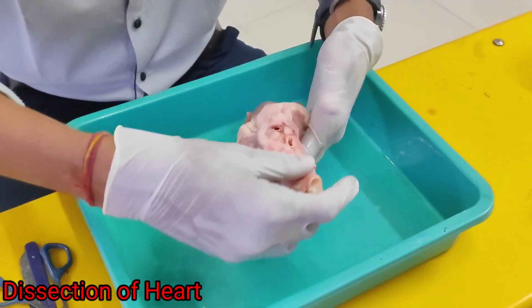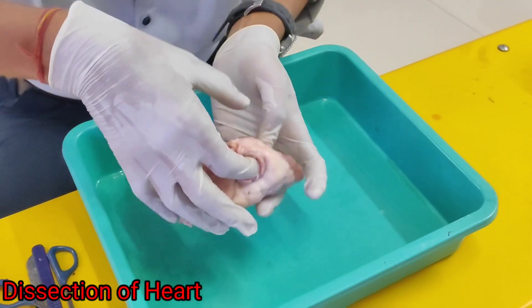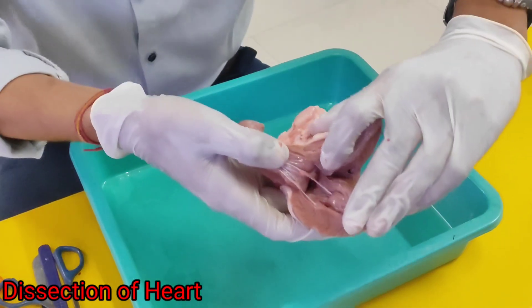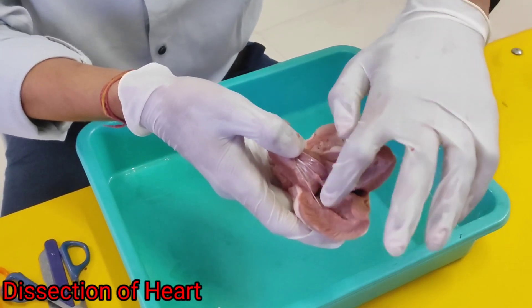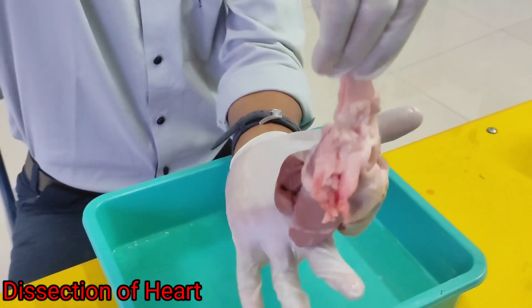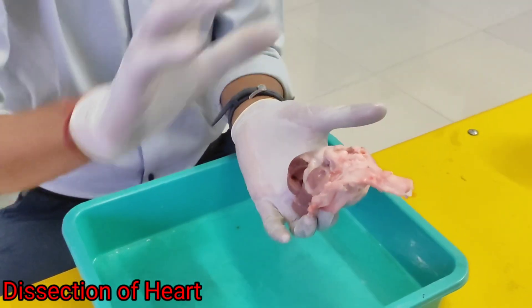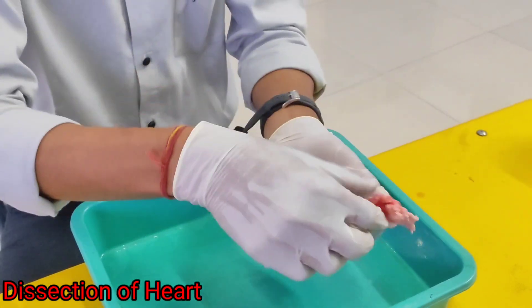Here you will see the atrium, where blood comes in. From here, blood comes and goes into the ventricle. This is called the ventricle part. From this ventricle, you can see a valve — this valve is called the tricuspid valve. From the atrium to the ventricle it comes, and then it goes upward. From here it goes to the pulmonary arteries — this part is the pulmonary arteries — and it transports the blood to the lungs.